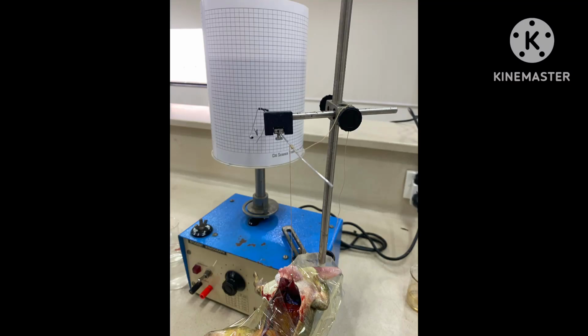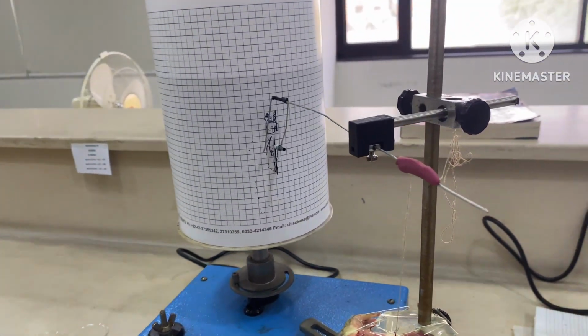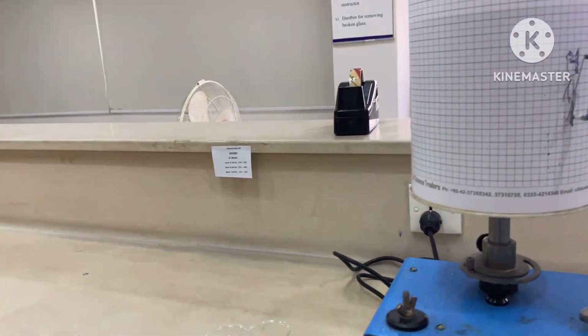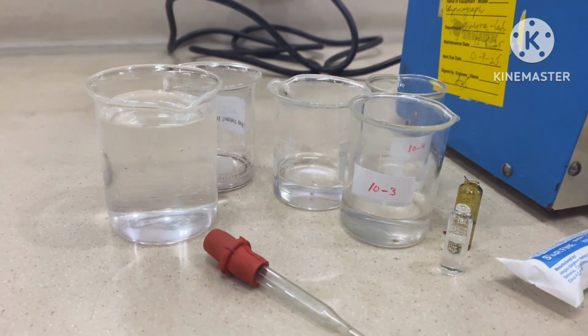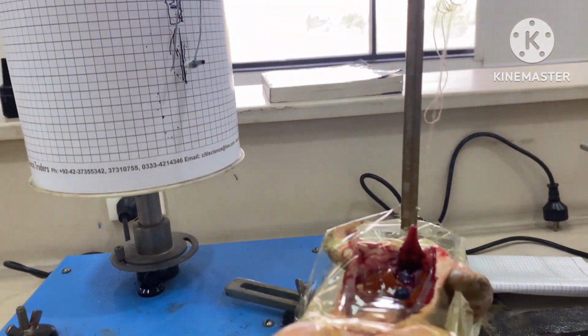Assalamu alaikum everyone. Today we are going to discuss the effect of depressants and stimulants on the frog heart and how to find an unknown drug. We'll test 4 drugs: adrenaline, acetylcholine, atropine and propranolol. I'll explain what each drug is, which receptors it acts on and why it speeds up or slows down the heart rate, and show the apparatus, run the experiment and interpret the results in this practical.